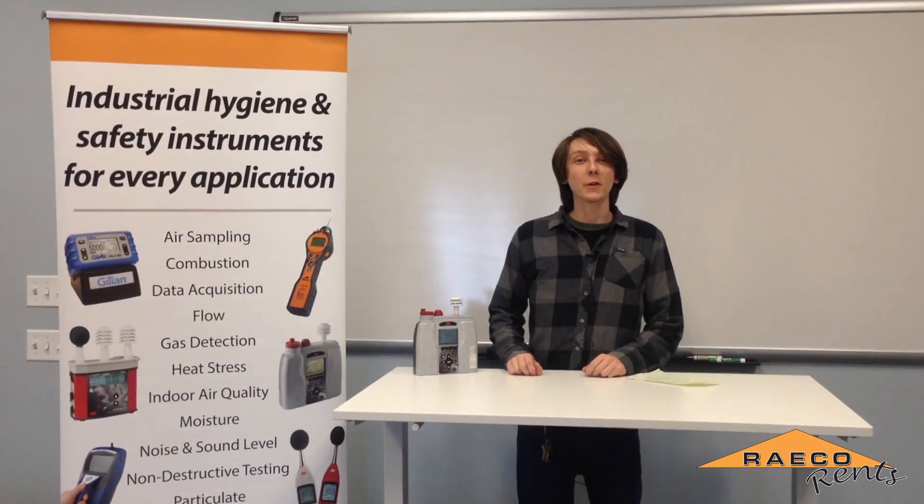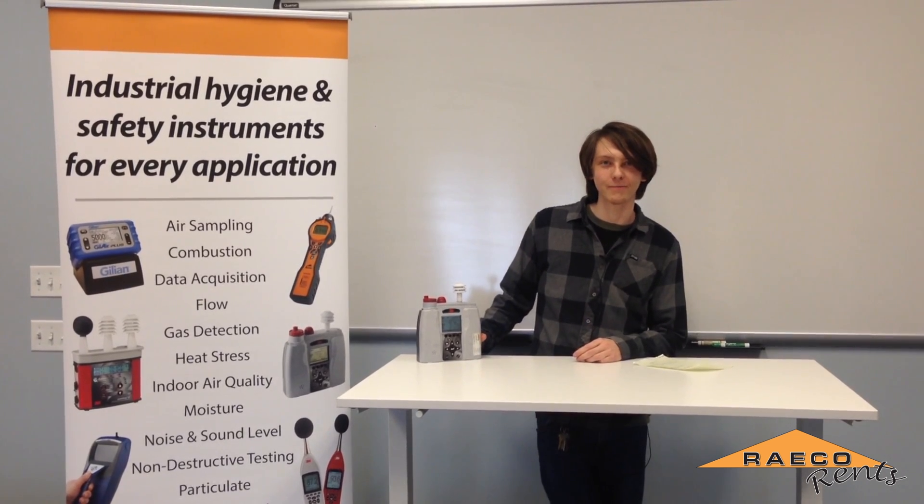Thank you for joining us today to learn about the EVM7 and how it works. If you have any other questions about this instrument or any others, feel free to give us a call.